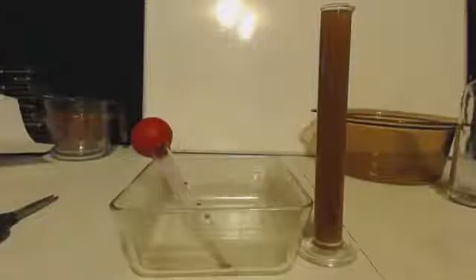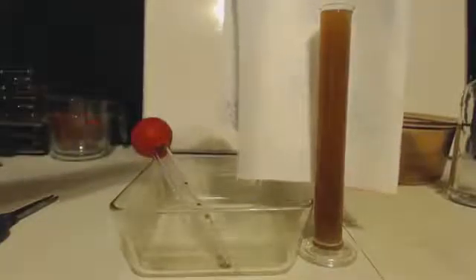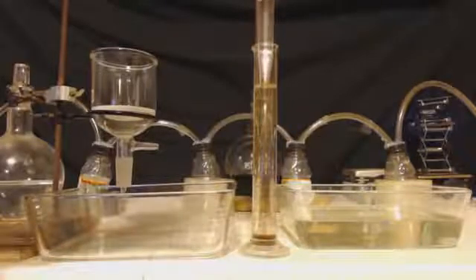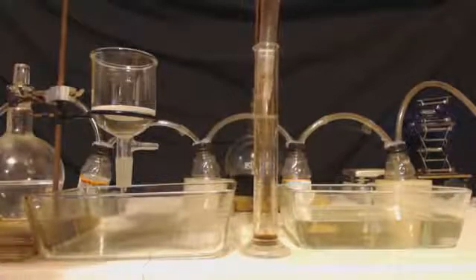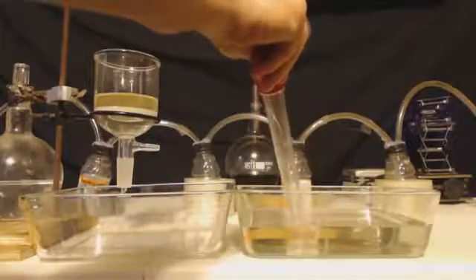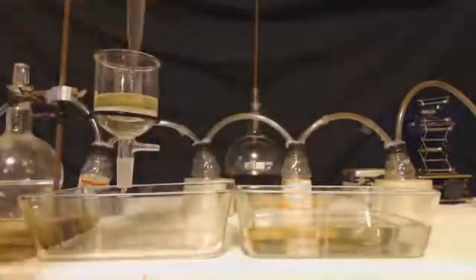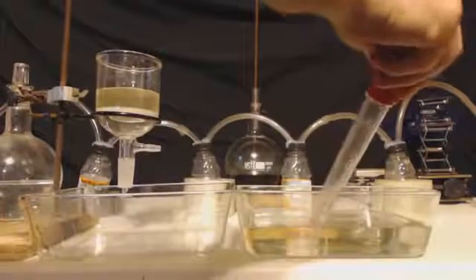Once you get all that out of there, just set it back on the radiator to heat. What I found is a lot of times more precip will happen, so even though the water looks crystal clear, it doesn't mean it is. Basically repeat this process until you get it down to just a little bit of particles, then you can really filter it out.